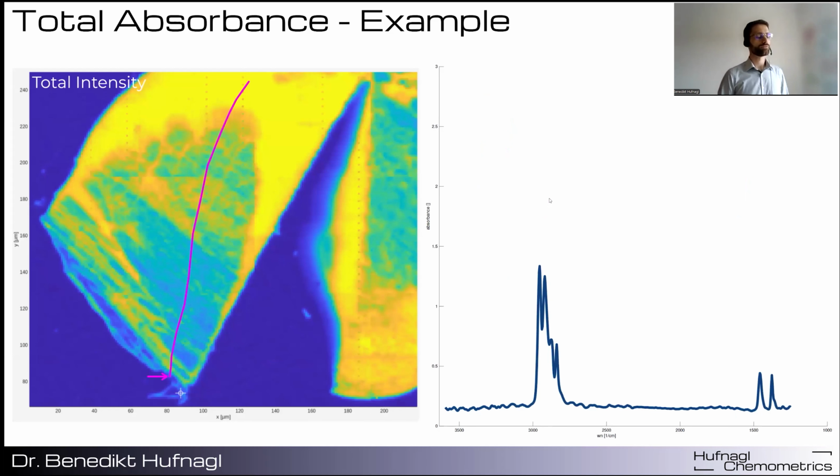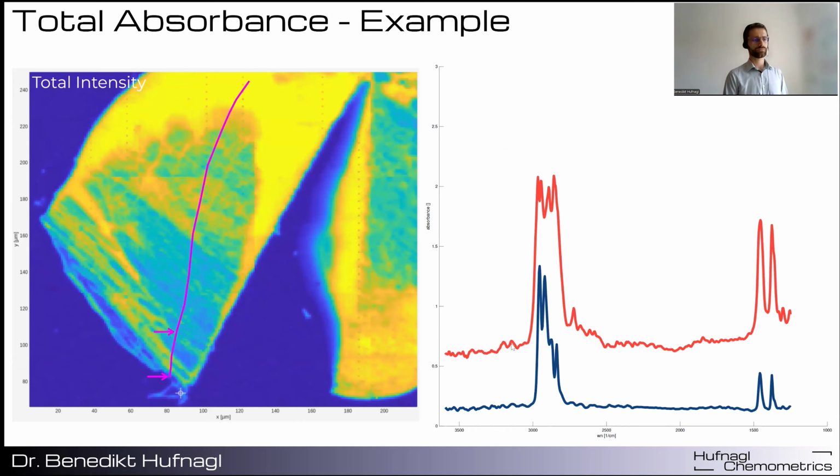And here you can see a real world example from a very thick particle, which is rather thin at the edge, but the thickness increases towards the center. And now I will sample across this particle some spectra. So here you have a very nice polypropylene spectrum. And already the next spectrum, you can already see the total absorbance effect. So here the peak is cut off.